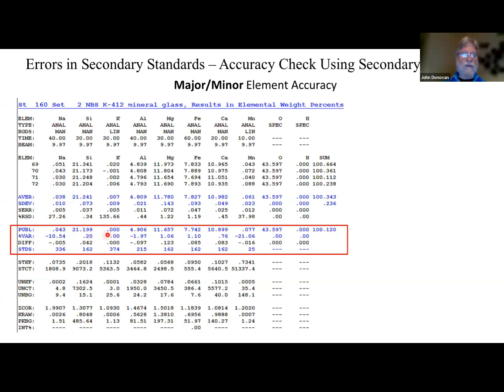Okay, so again, you now have an immediate evaluation of the accuracy of your setup and your tuning on your instrument. And this is what you want to know. This is what we need to know if we're not flying blind. And the numbers here are the primary standards that we use. In the case of the silicon, we use the K411 glass here. Let's see, the aluminum here, 215, that's the USGS synthetic basaltic glass. So these are all pretty good numbers. We're within basically 2% for everything except the traces, and those are within the standard deviation of the analysis.